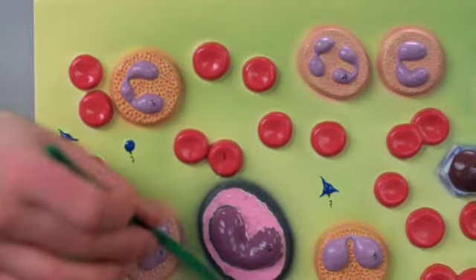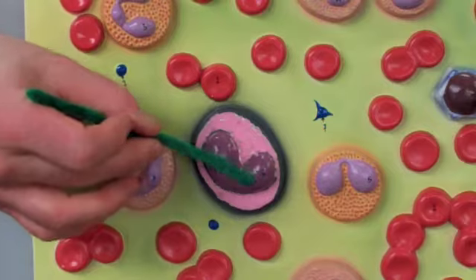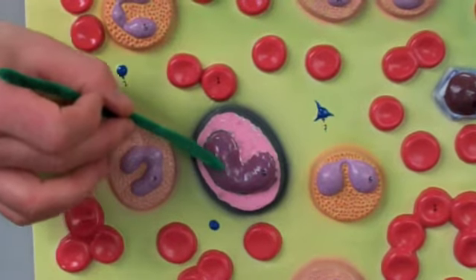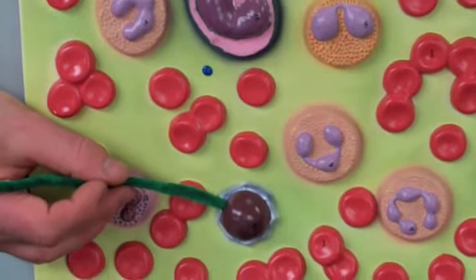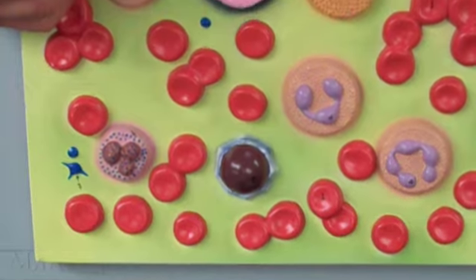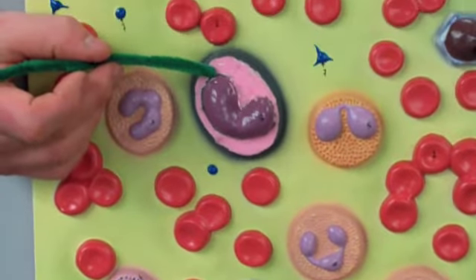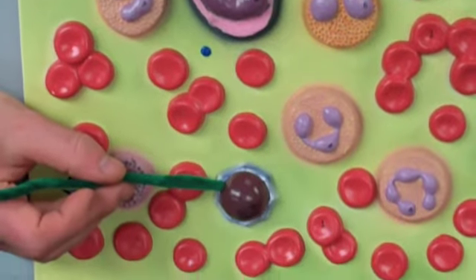And then we have two other cell types on here that we're interested in. This big one with a nucleus that's sort of boomerang shaped almost. And then the one here that is smaller, but the nucleus is almost as big as the cell itself. The big one is the monocyte, and the smaller one is the lymphocyte.